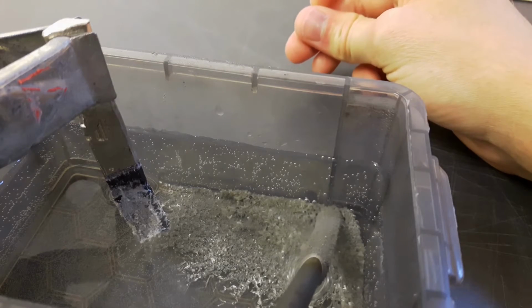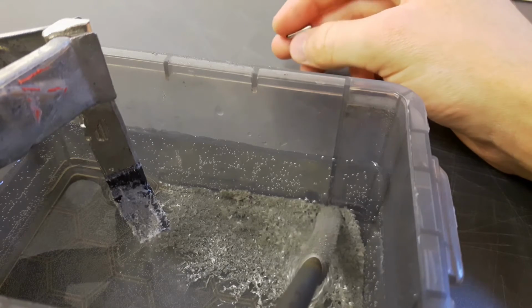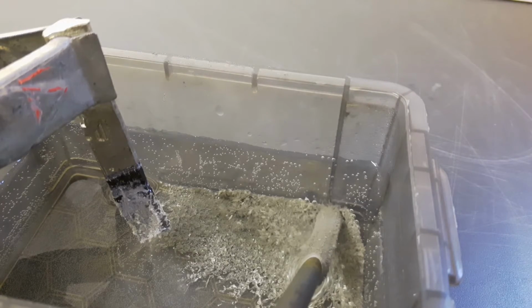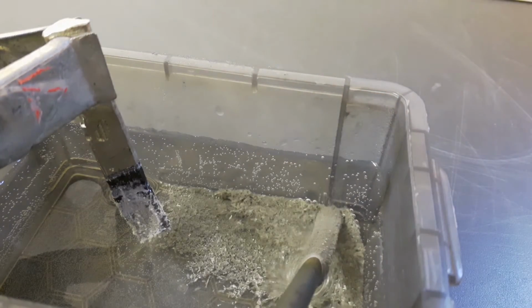And after playing a bit around with the magnet, it turned out that the white clouds that are formed below the tin electrode, the white stuff, is tin oxide or tin oxychloride or whatever, and the tin ions are basically invisible. But you can see these blurred lines in the water because of the density difference, and that's actually where the ions are dissolving, and they do react to a magnetic field. Actually, they do react to this cheap magnet.